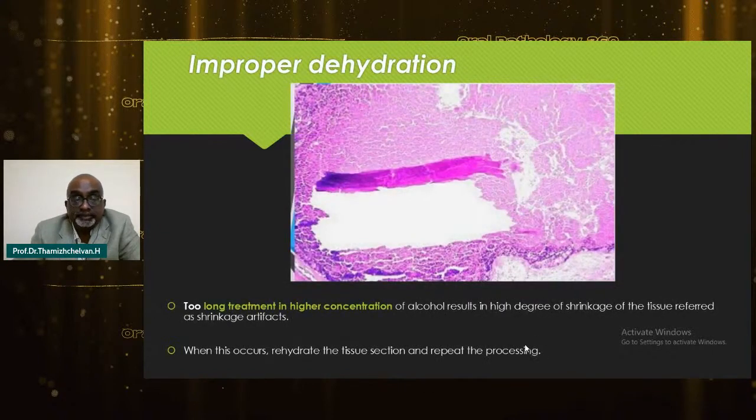So what happens here? Improper dehydration, that is too long treatment in a high concentration of alcohol, can cause a high degree of shrinkage of tissue, referred to as shrinkage artifacts. When this occurs, how do I go about it? Rehydrate the tissue section and repeat the processing.